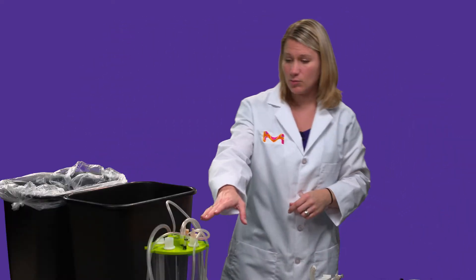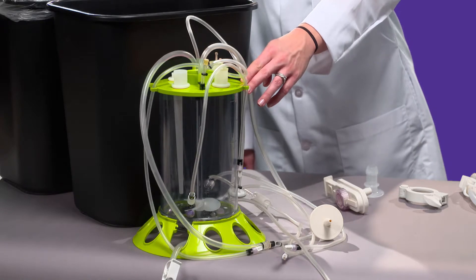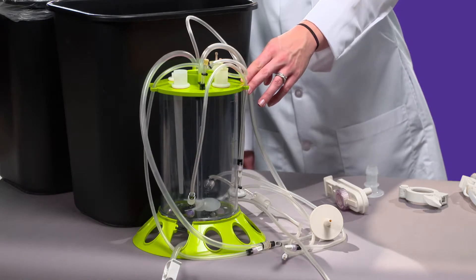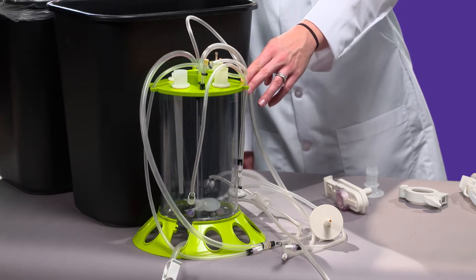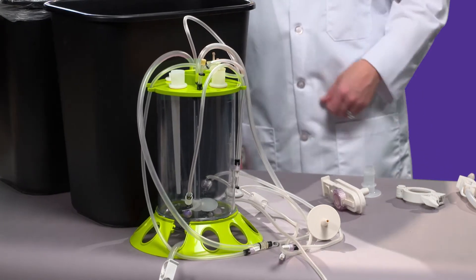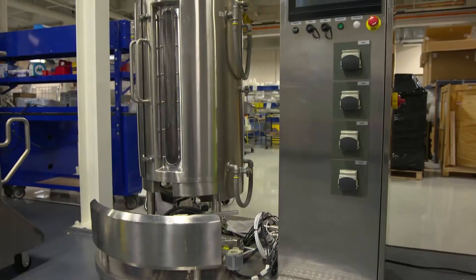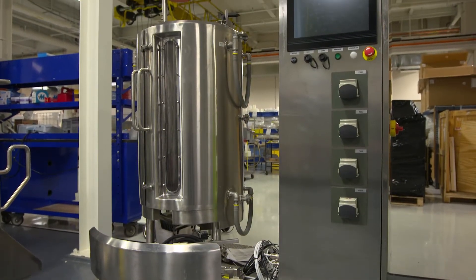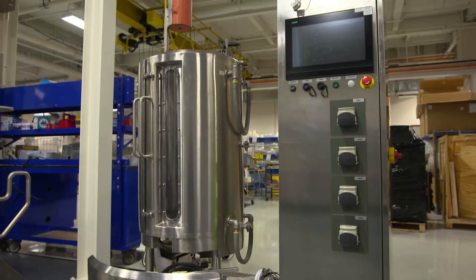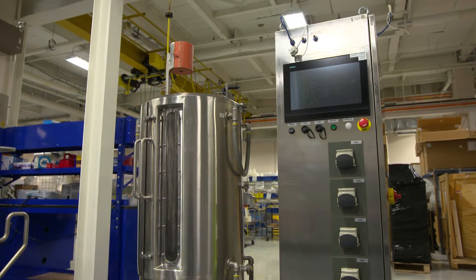And then lastly, we have a single-use system. This is going to be an engineered processing system that utilizes single-use components to execute a full unit operation. These would be things like single-use bioreactors or single-use mixing systems.